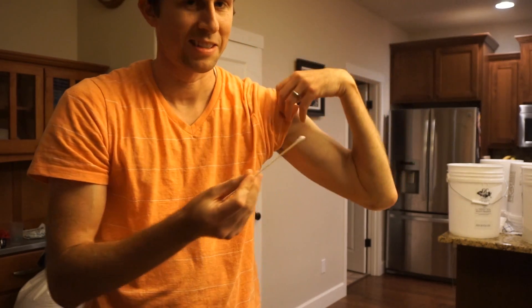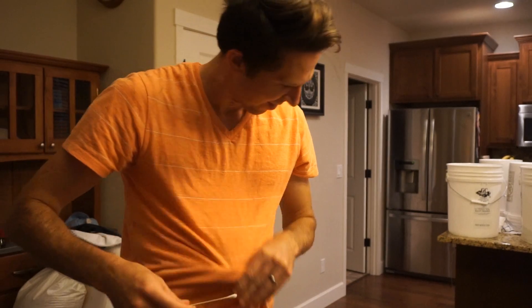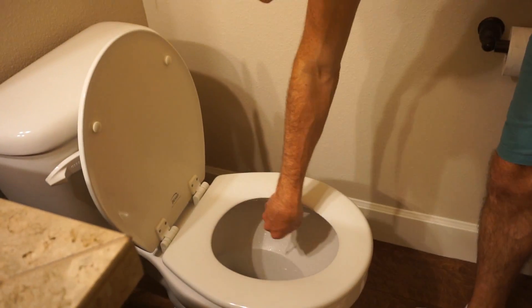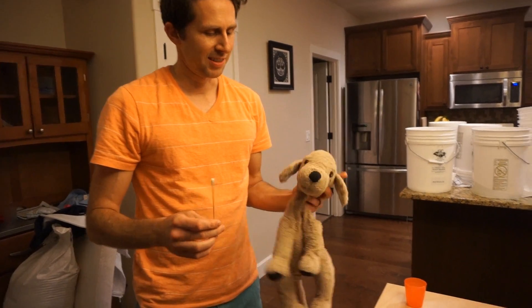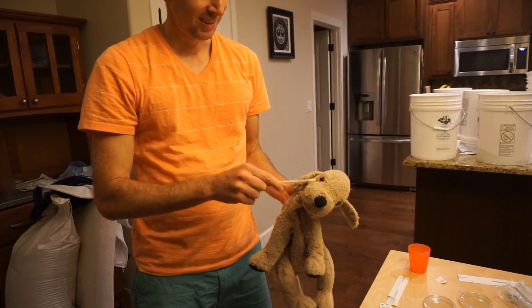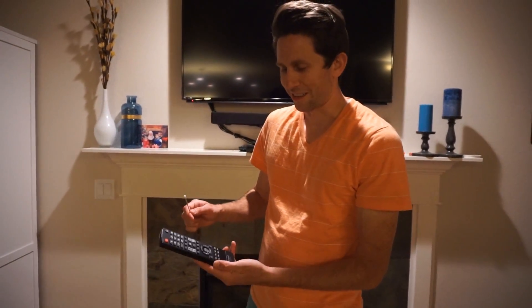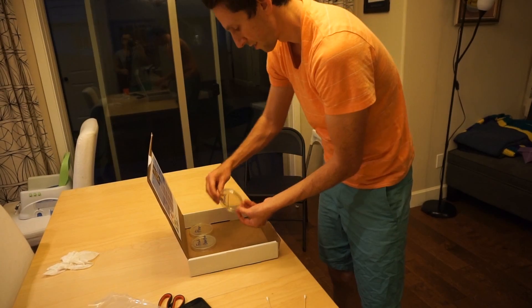Your belly button. Your belly button is gross. I'm going to do the toilet — I'm going to go inside the toilet on this one, all around. This is my son's stuffed animal — his face. Here's our family remote control.